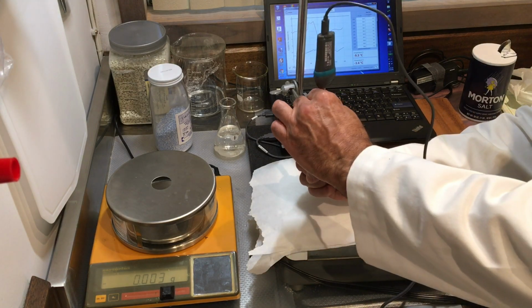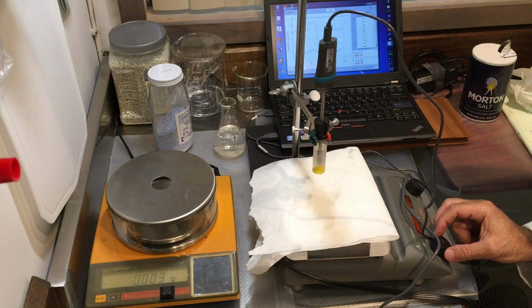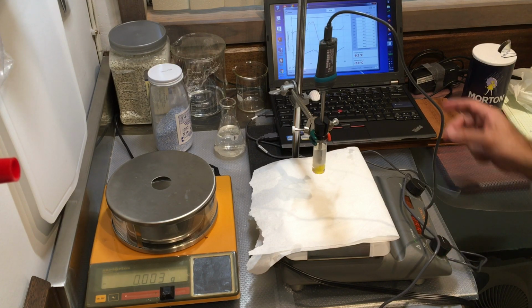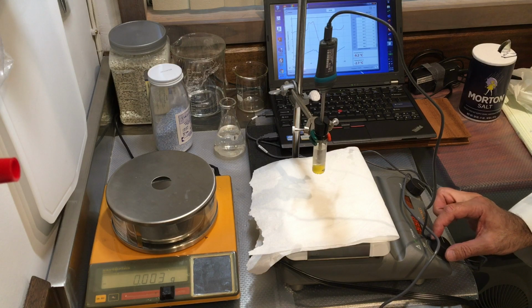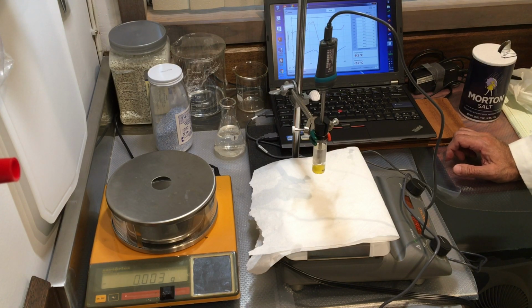So we are now working on the melting process. We're looking at the melting. There it is. So everything is moving. Temperature is rising, -2.9. So we're watching the melting now. There was a big chunk of ice in there. I'm going to let that melt.